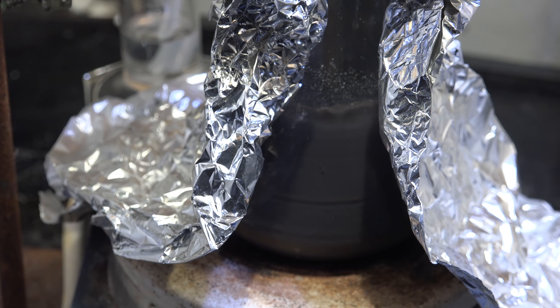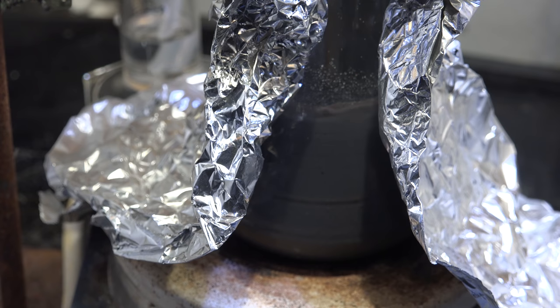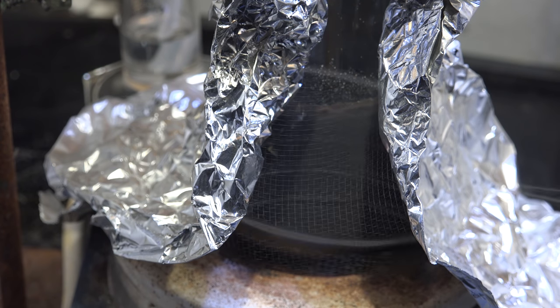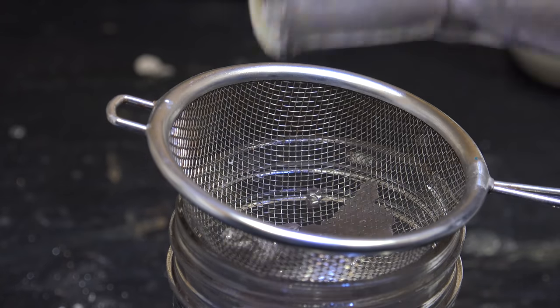At least it worked though, I can see a small amount of sodium metal in there. Lithium is solid at these temperatures so any liquid metal would have to be sodium or at the very least a mixture of lithium and sodium. So I let it cool and process the resulting metal.